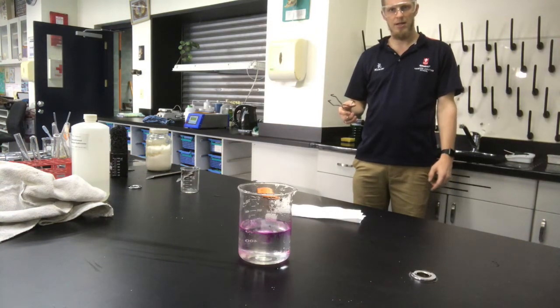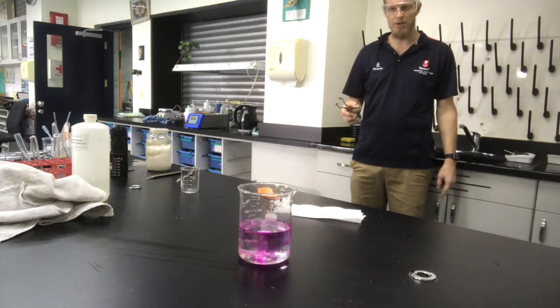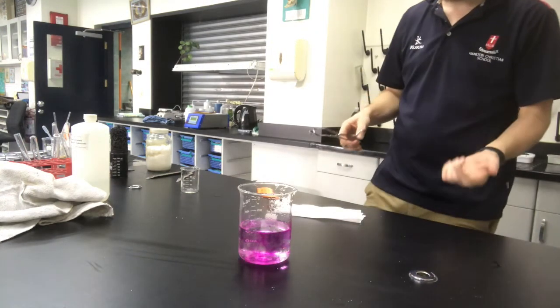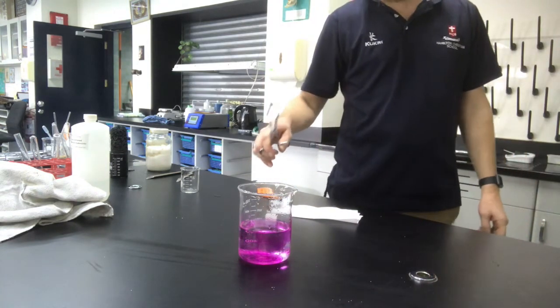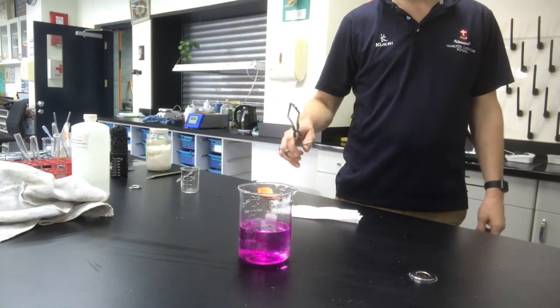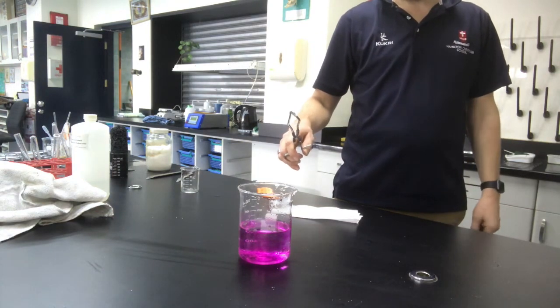So you can see the water's changing colour. I'm producing some potassium hydroxide. The metal is kind of scooting around on the top, okay, and it actually, when I did this for practice, it exploded on me. So I got a slightly bigger piece here, okay, so we'll do the same again, right, but you'll see it kind of scoot along the top, it fizzes, so it's producing hydrogen gas and potassium hydroxide in the water.